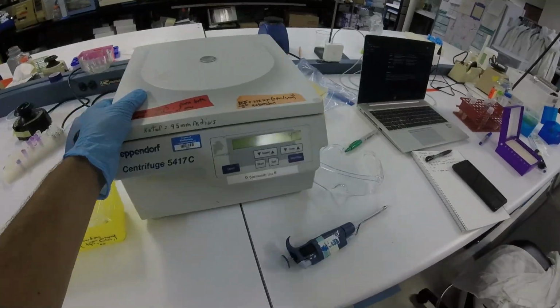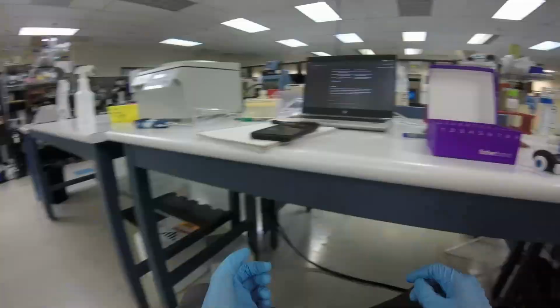Anyway, I'm going to take another crack at it today. One other cool thing is I'm going to try to use this thing that they showed me called the plate reader, which apparently can do incubation for each well in a 96 well plate. It can set the temperature and shake it, and then it can record the OD 600. So today, because I don't have time to do the electroporation, I think I'm going to do a massive growth curve experiment because I was not satisfied with the results.